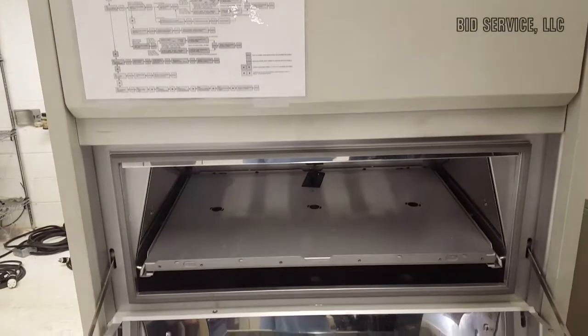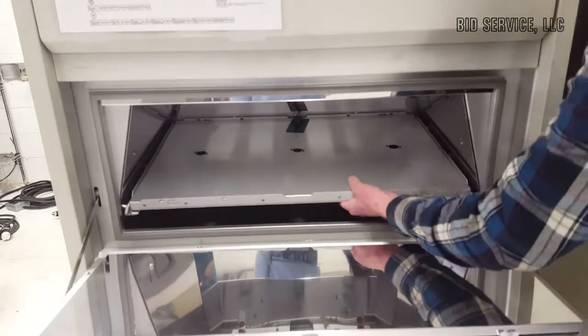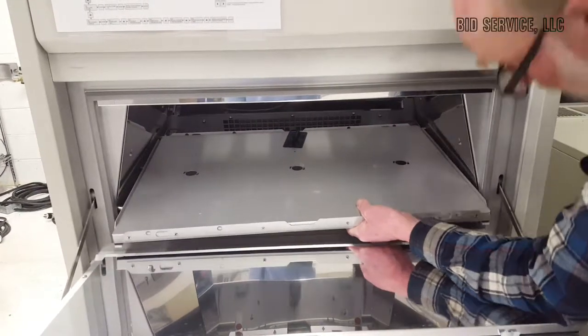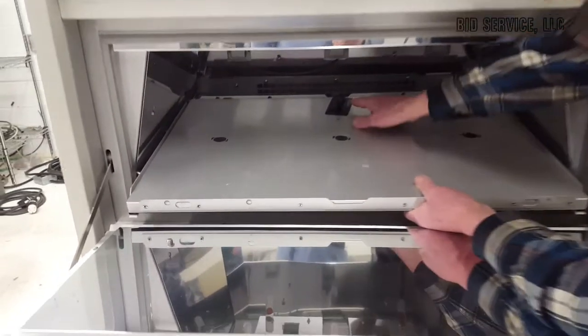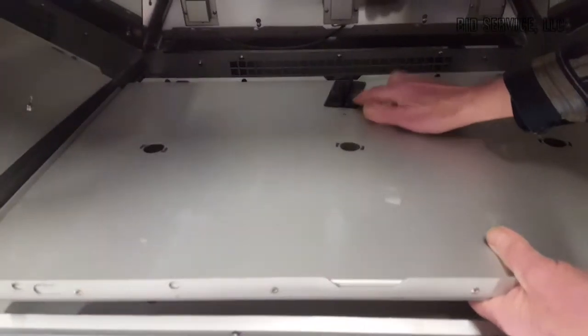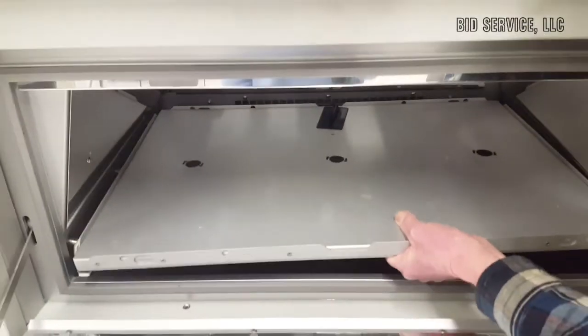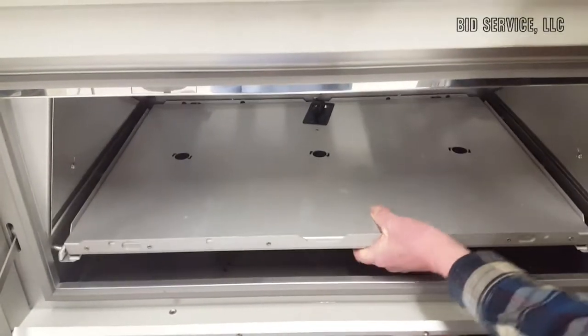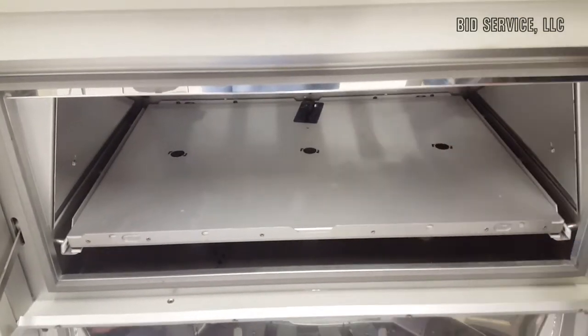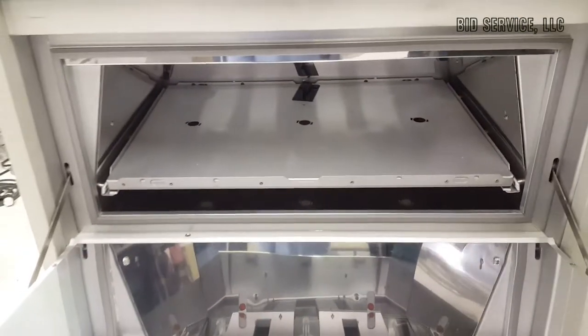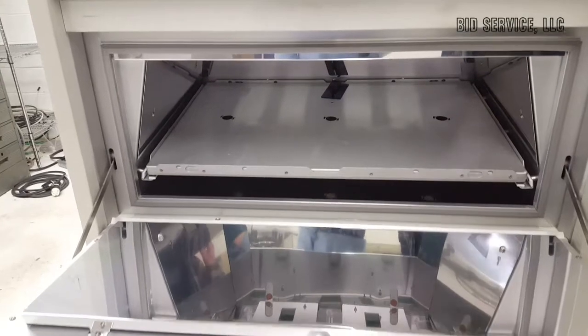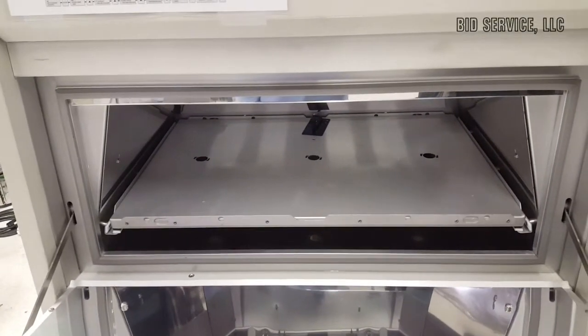Now, this is the inside chamber where you have your tray, and you can put your specimen. This is the black panel temperature probe. The black coating on it allows it to uniformly absorb all wavelengths coming down in the chamber.